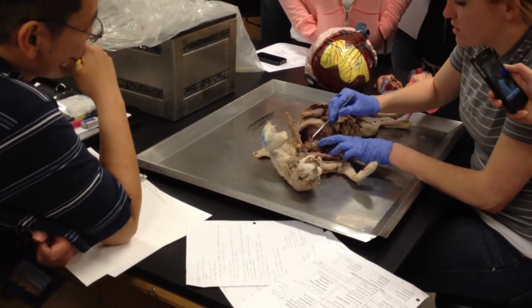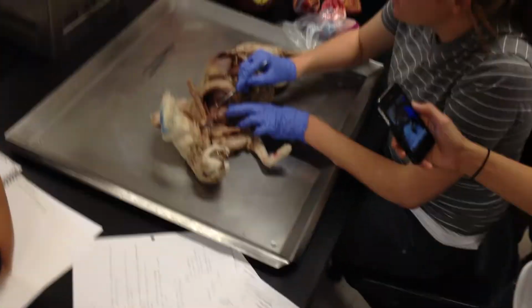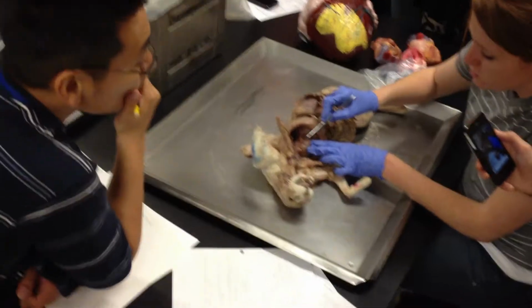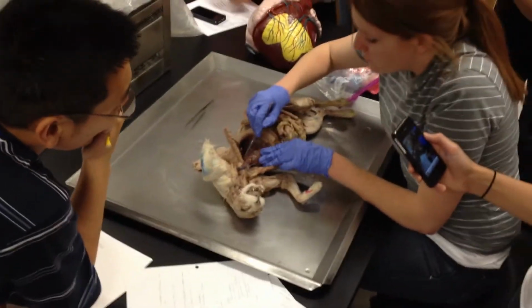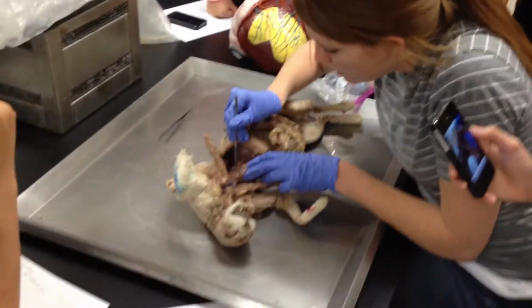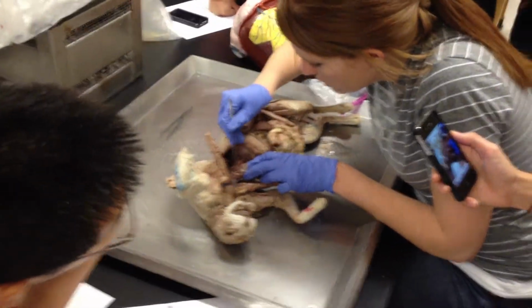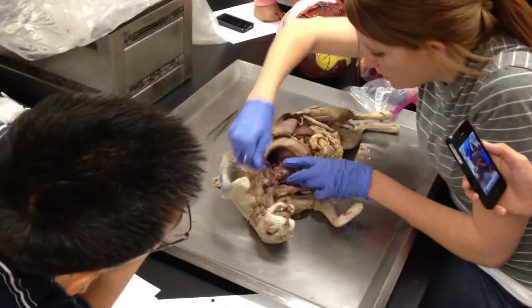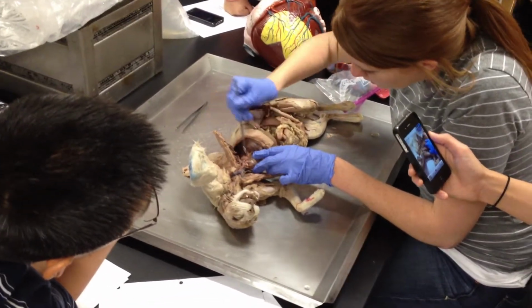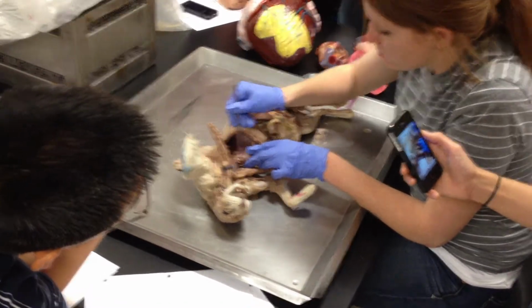Here, right? What's this called? Your little ear-like thing. This is the auricle. Right here. This guy right here coming off, this is my aorta. I didn't quite get it cleaned out. There's so much fat on this guy, it was ridiculous.